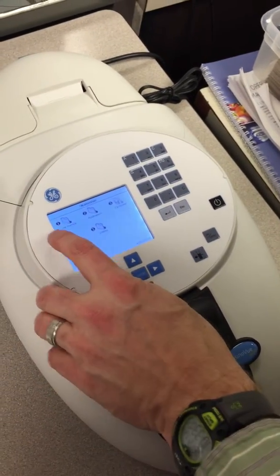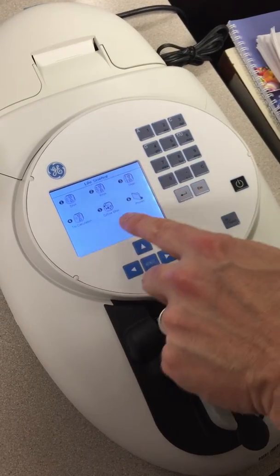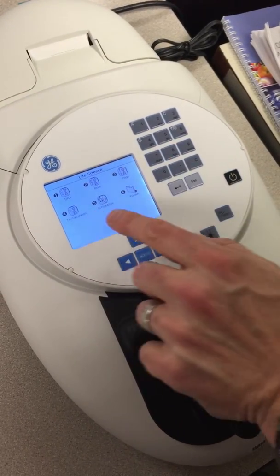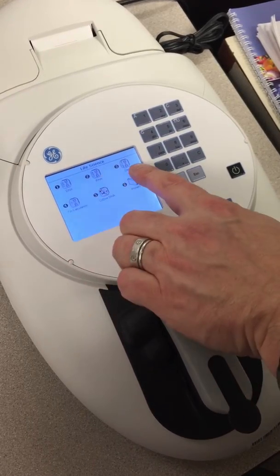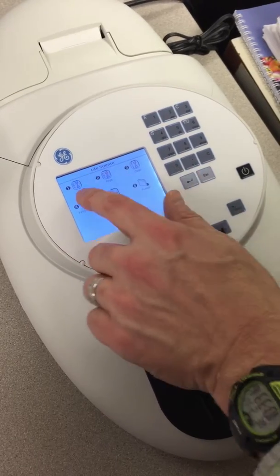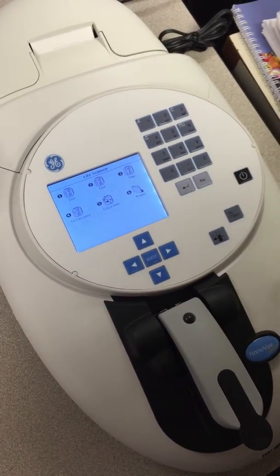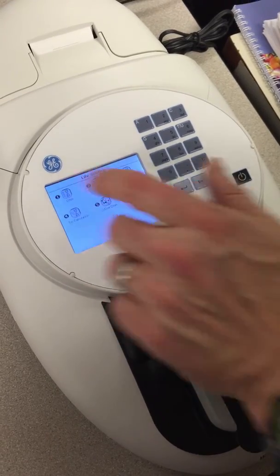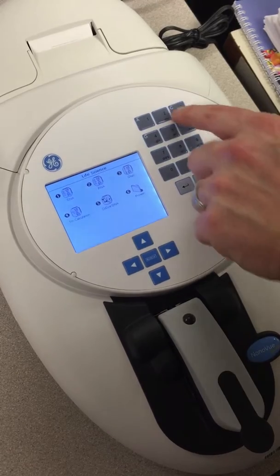And what I'm going to do is choose life science rather than these other options. And that will take me to a screen that illustrates several different options here. Double-stranded DNA is here, RNA is here, and oligo is here. Most of the time we're doing double-stranded DNA, but today actually we're going to be testing oligos. So that's single-stranded DNA, and the absorbance is different than what you have for double-stranded DNA. And so the calculations are different, and thus that's what we're going to end up choosing.